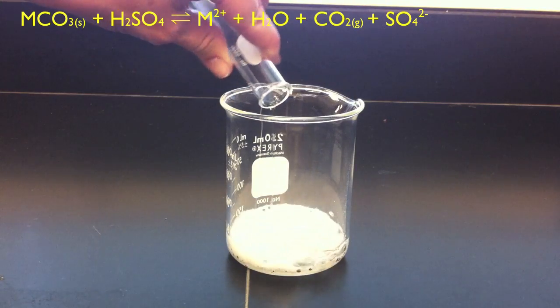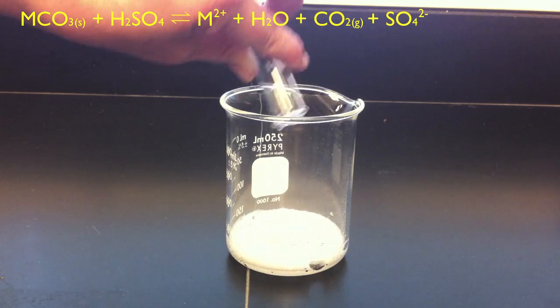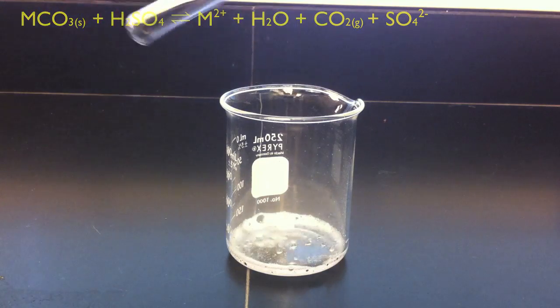Pour all of the acid into the beaker with the carbonate solid. This will cause the evolution of carbon dioxide gas.